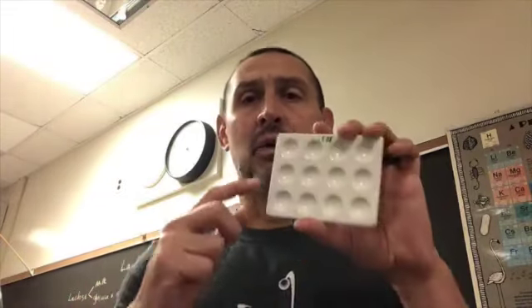So the first thing we want to do is have a control. So what we're going to do is fill this well plate with some solutions. We'll put water as our control, and then we'll add across this row a normal set of solutions, milk and glucose and milk plus Lactaid. And then we'll also add some of those things in this row, but we'll add some acid to it. So take a look at how we should set up our well plate.